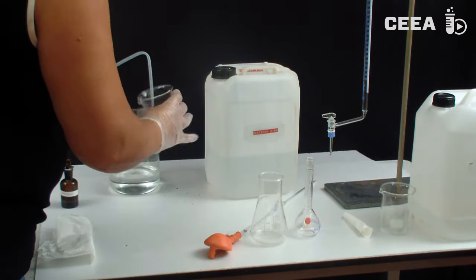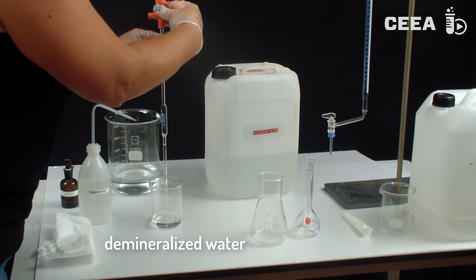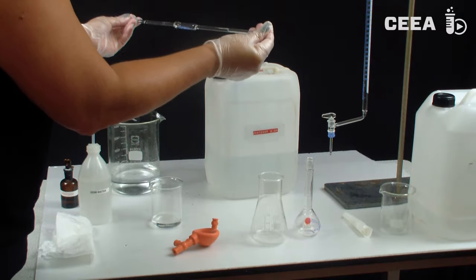All this sounds simple, but because of the need for accuracy, the equipment has to be prepared thoroughly before being used.